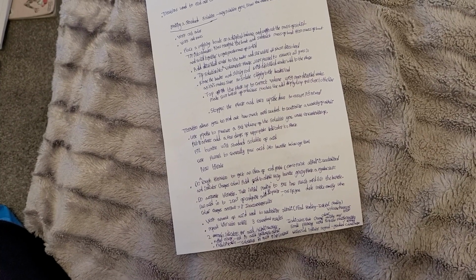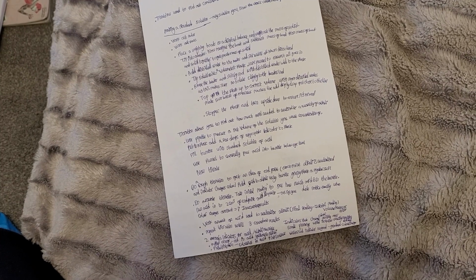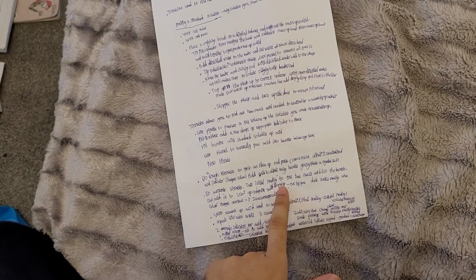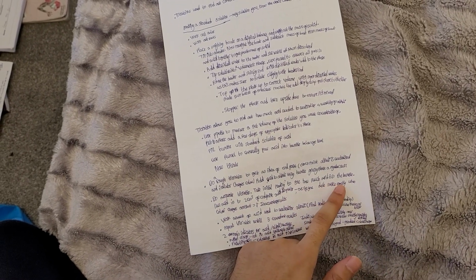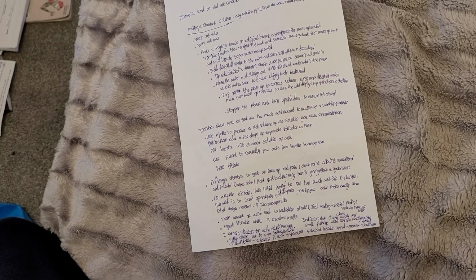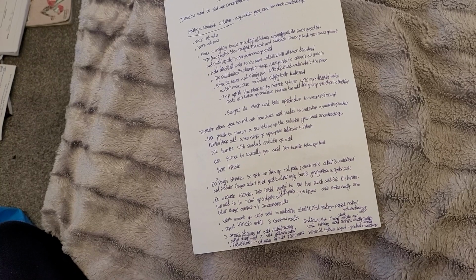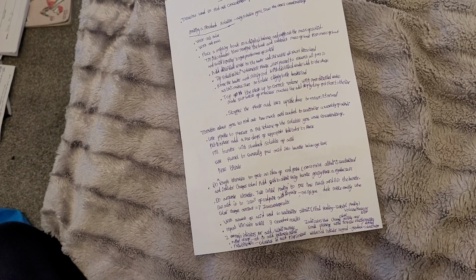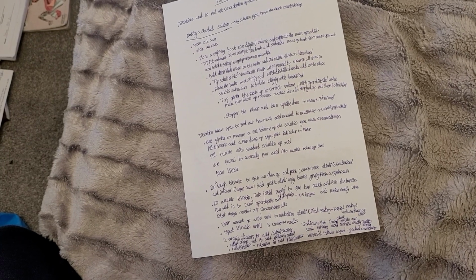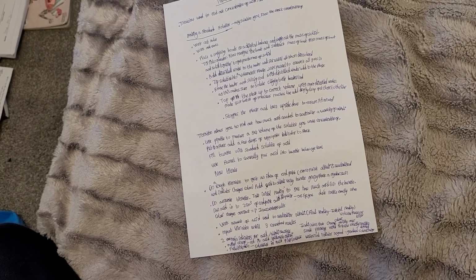Add dropwise. That's why we add dropwise, because if you don't, then you won't notice exactly when the color changes and you overshoot, therefore giving inaccurate results. Work out the amount of acid used to neutralize the alkali, that is final reading minus initial reading, and this volume is known as a titre. Repeat the titration until you get 3 concordant results. And obviously, if you get anomalous results, anomalies, you ignore them.